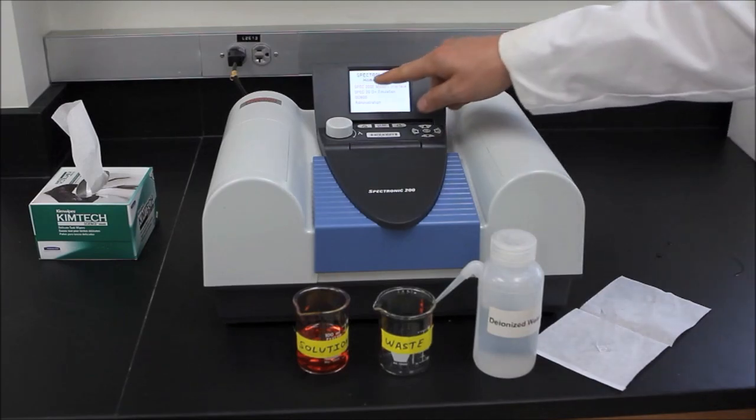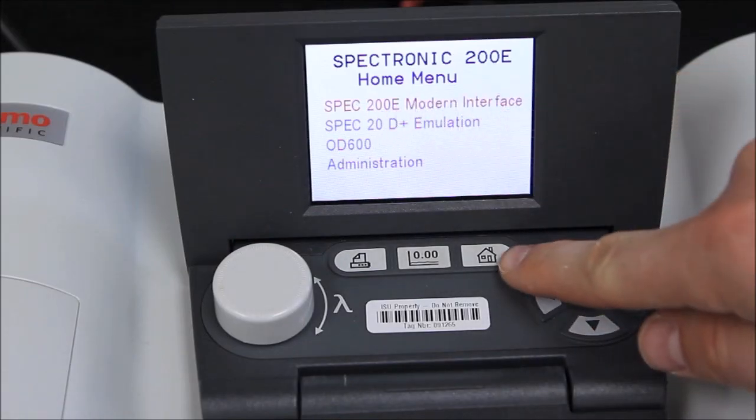When you are ready to use the instrument, it should already be turned on with this Home menu displayed. This menu can be returned to by pressing the Home button.